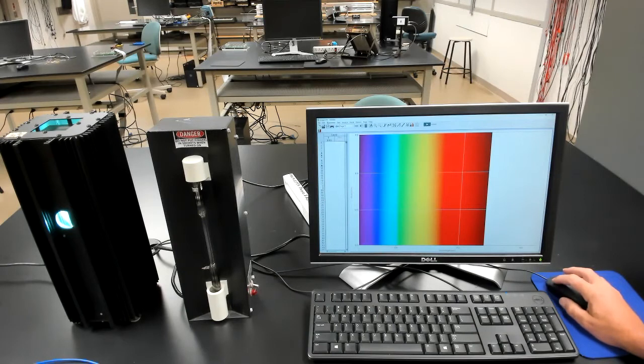The next thing to do is to go to Experiment and choose Change Units, because we're going to use the spectrometer right now in what's called intensity mode, where it just measures intensity as a function of wavelength. That's distinct from the normal modes, which are transmission or absorption. So we'll select intensity, and then we'll look at the other parameters.